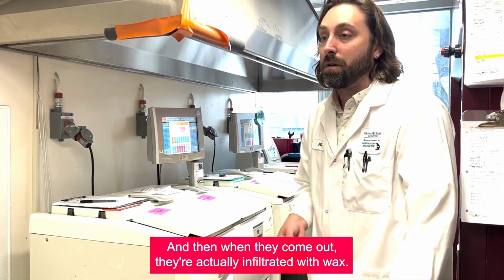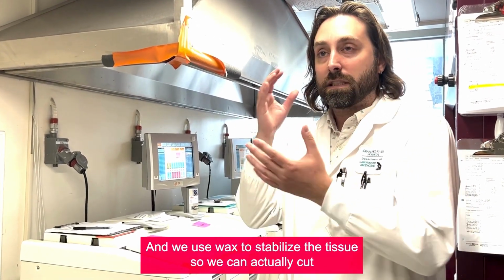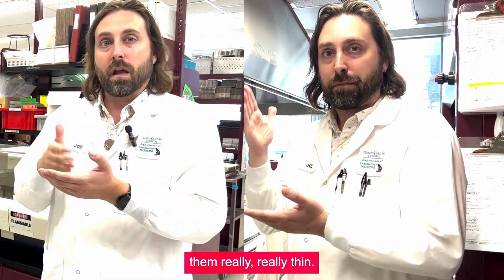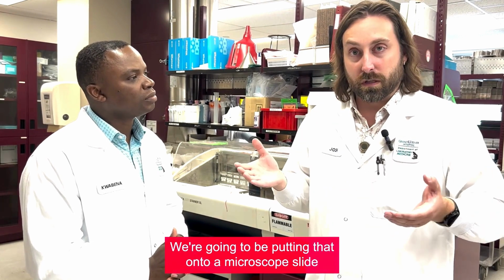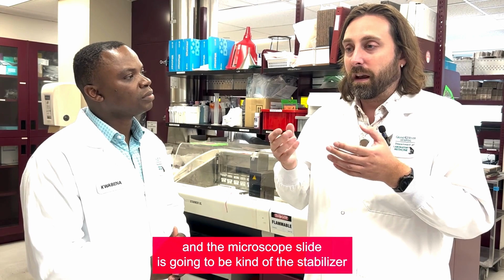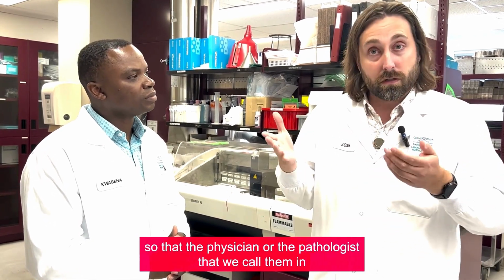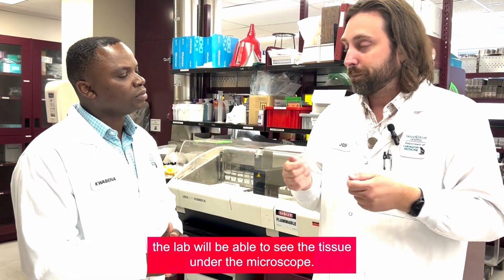And then when they come out, they're actually infiltrated with wax. We use wax to stabilize the tissue so we can cut them really thinly. With those really thin cuts, we're going to be putting that onto a microscope slide. The microscope slide is going to be kind of the stabilizer so that the physician or the pathologist, as we call them in the lab, will be able to see the tissue under the microscope.